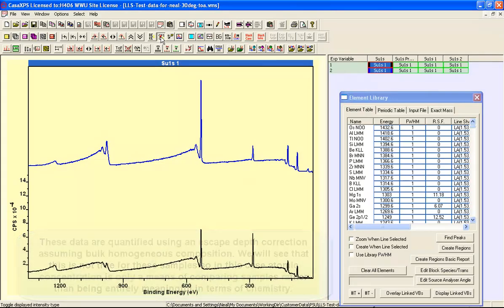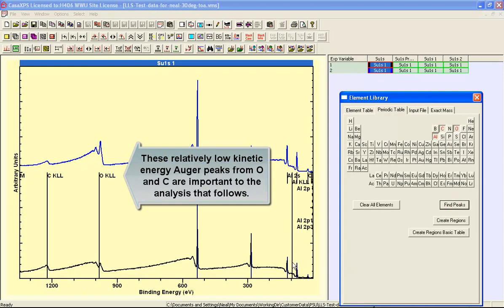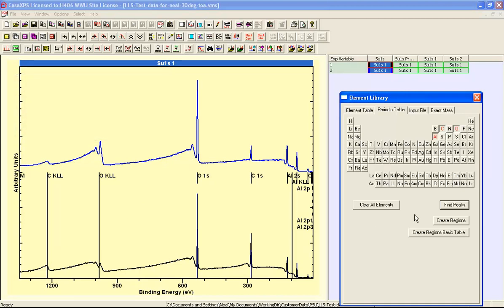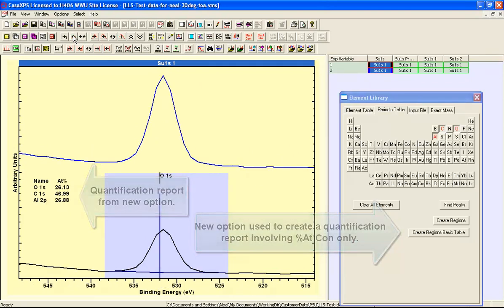And I'll also just switch to arbitrary units, and using the element library, if we say find peaks, you can see that it identifies the oxygen 1s, the carbon 1s, two aluminium peaks. There's potentially an Auger peak between them, and we have Auger peaks here for oxygen and carbon. So let's now say create, and this has placed regions on these data.